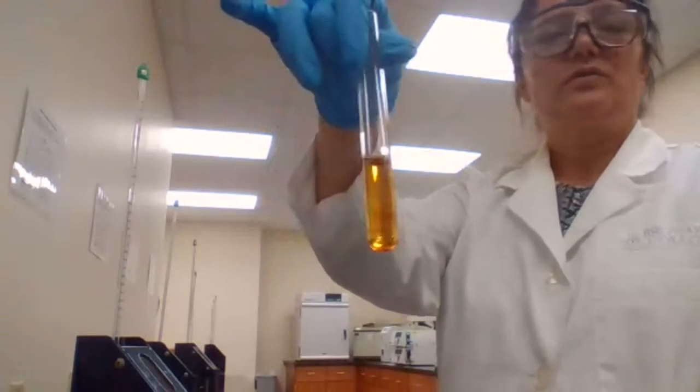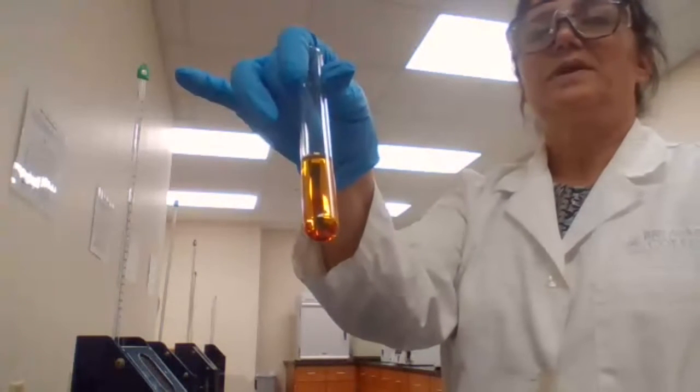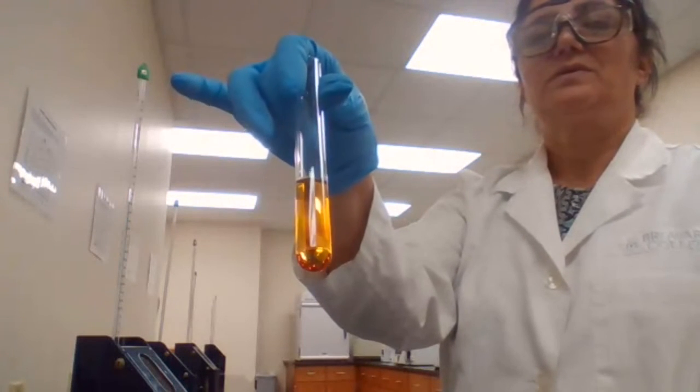Here is the result for the iodoform test. I think one of you asked for it. Sure.